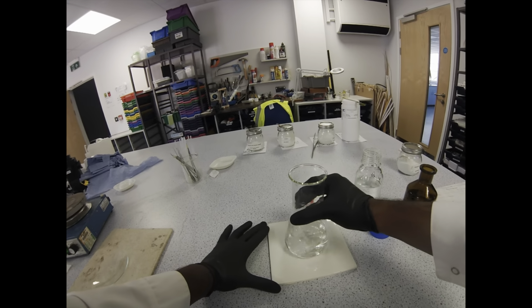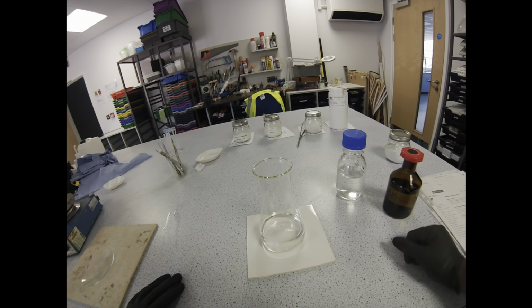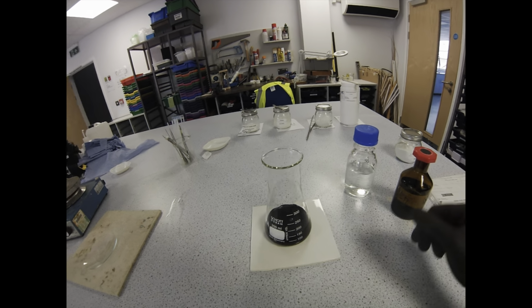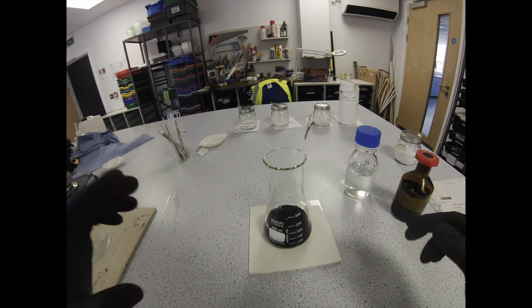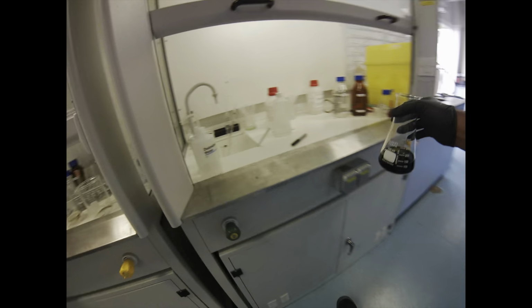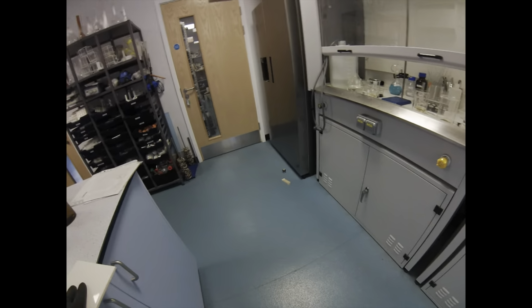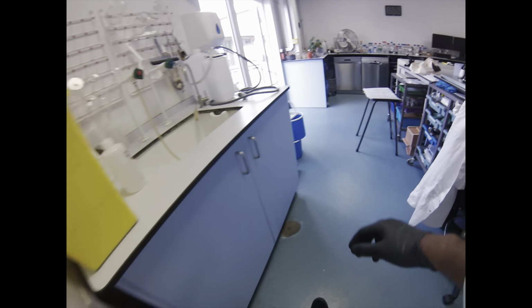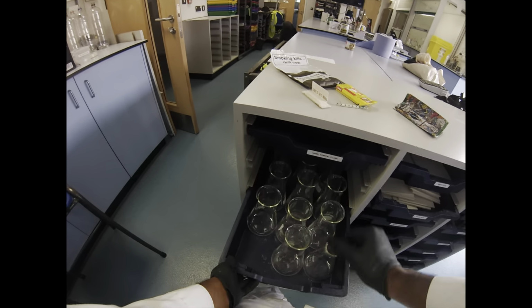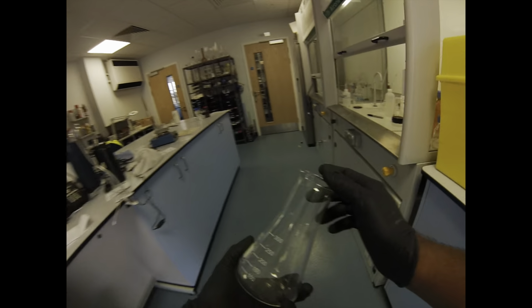If I'm demonstrating, I'll just roughly eyeball 50 ml of each. I like to do one good swirl and then just let it stand. Don't take your eyes off it. The deep blue-black colour is from all that potassium iodide that we dissolved in, so it is critical to dissolve quite a lot of potassium iodide. I have seen variations where you use less, but it's just not as striking. You could probably leave it out for a little while, but realistically that wants to go in the fume hood as soon as possible. You are actually going to be liberating iodine gas because of all the potassium iodide you've dissolved in. Hopefully we'll see some of that in a bit.